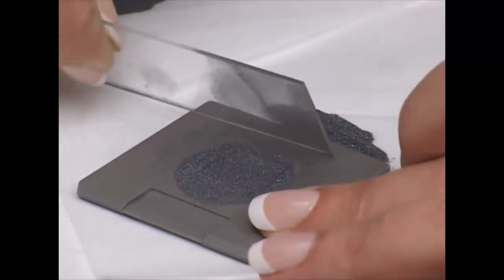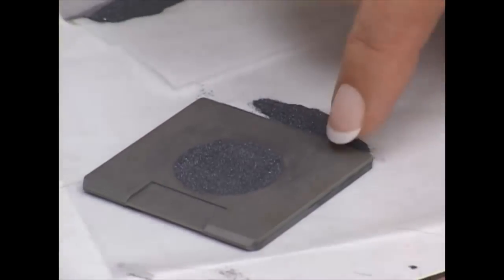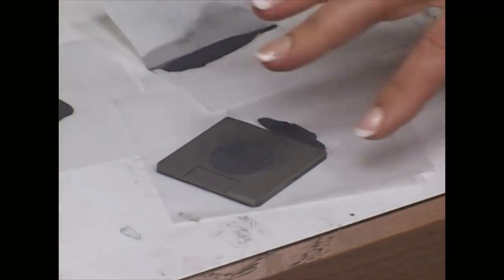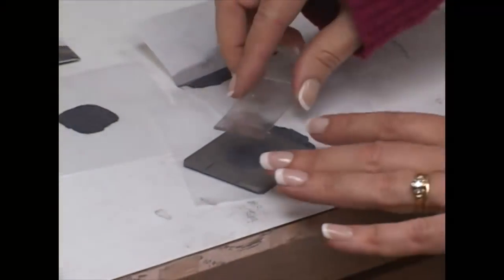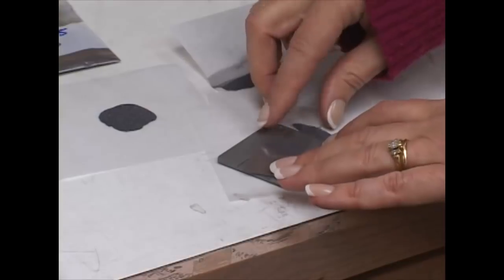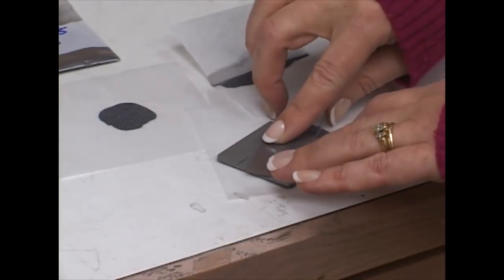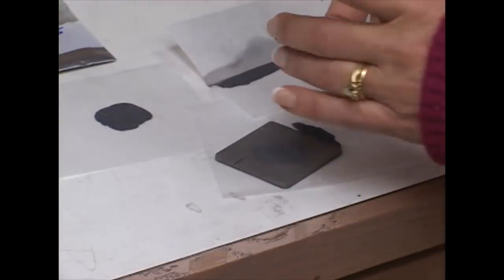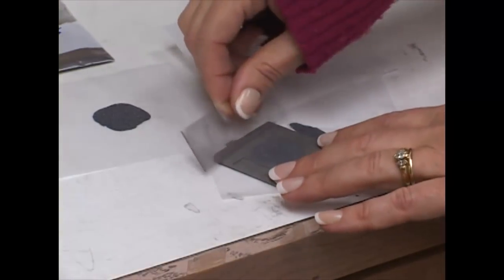And you want to keep it cleaned up because, keep in mind, you are going to put this in and there are going to be three pins on three places on the sample holder and if there is a lot of material underneath there that is going to actually alter the angle that it is sitting at and you will get your positions will be off. Just flatten it down and that is ready to go.